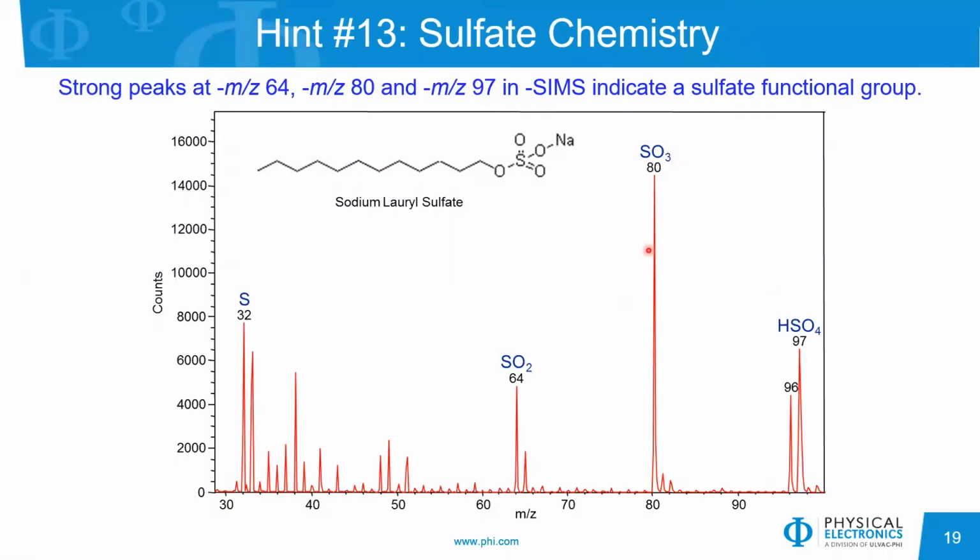Similarly, for sulfate chemistry, you will always see a peak in the negative ion polarity at a mass to charge ratio of 64 and 80 and 97. And these are the SO2, SO3, and HSO4 ions. It is not always the case that you will see an intense sulfur peak. But for sulfates, you will always see strong peaks at 64, 80, and 97.